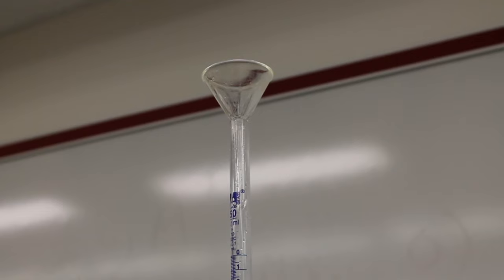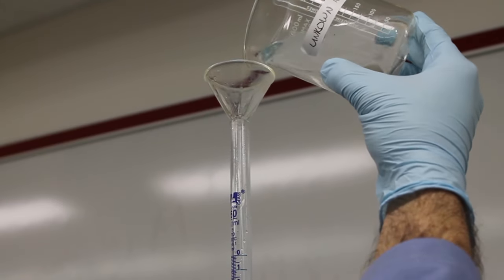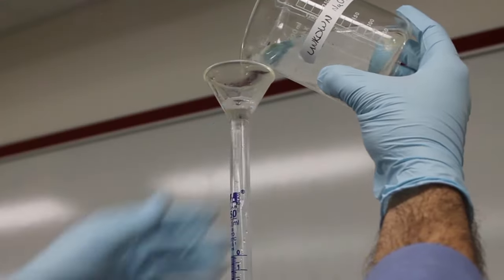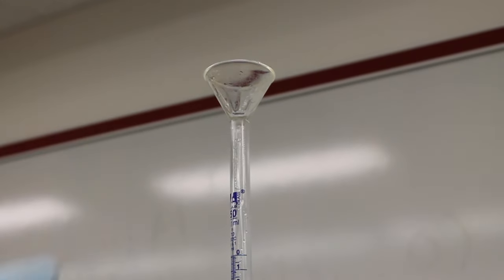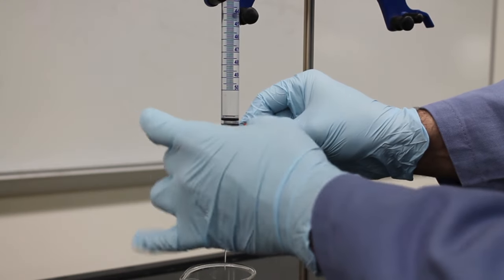Using your unknown NaOH solution, rinse out the inside of the burette. While you do this you need to try to get out any bubbles that may be in the tip of your burette.